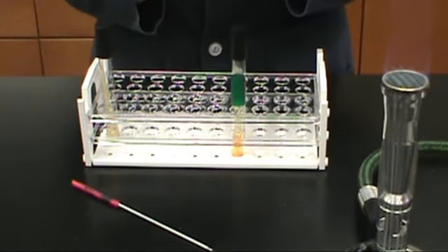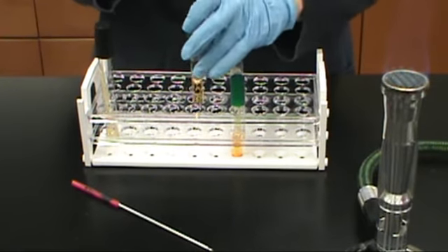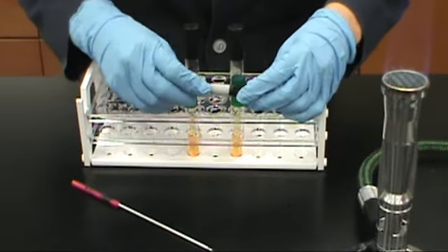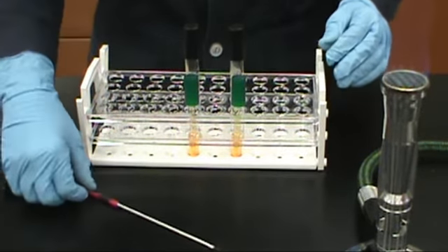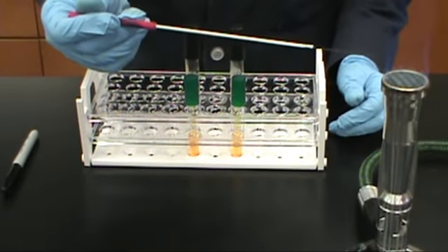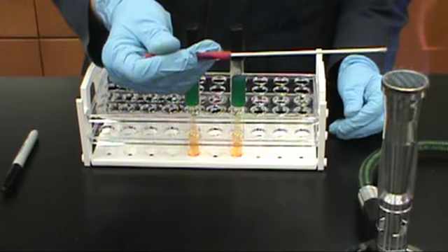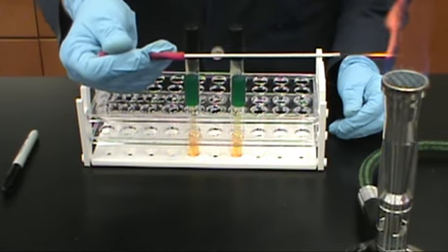Urea is a nitrogenous waste product produced when amino acids are broken down. It is a very rich nitrogen source. Some bacteria are capable of producing an enzyme known as urease. Urease will break down urea into water, carbon dioxide, and ammonia. The urease broth contains urea, a phosphate buffer, and the pH indicator phenol red.